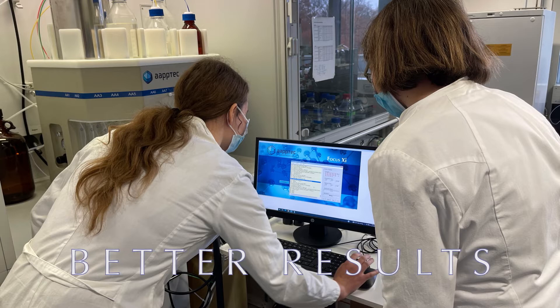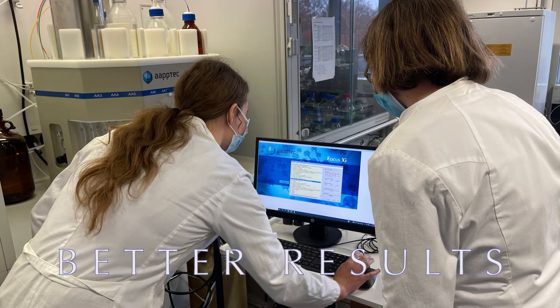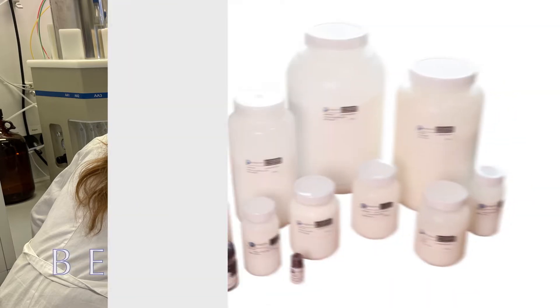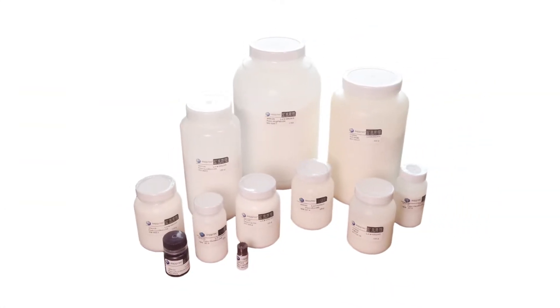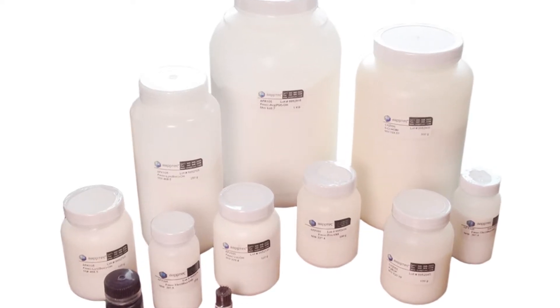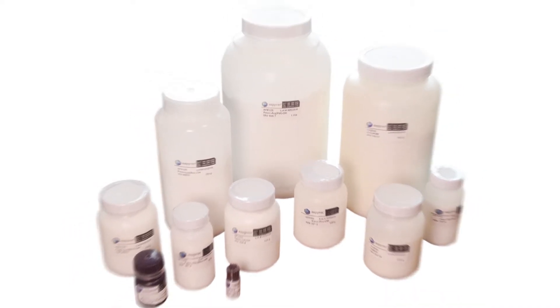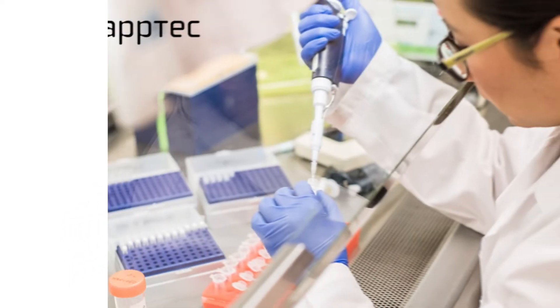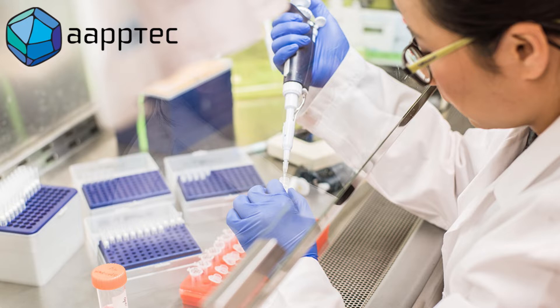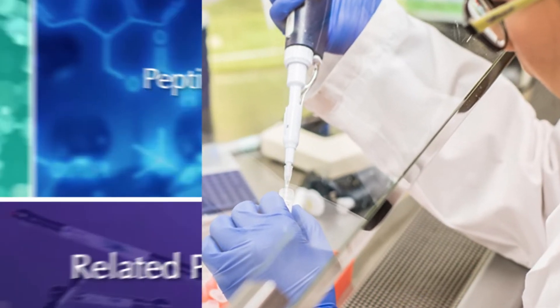We assure you that our automated peptide synthesizers and peptide synthesis reagents provide high-purity crude peptides with minimum solvent consumption and the lowest production costs.